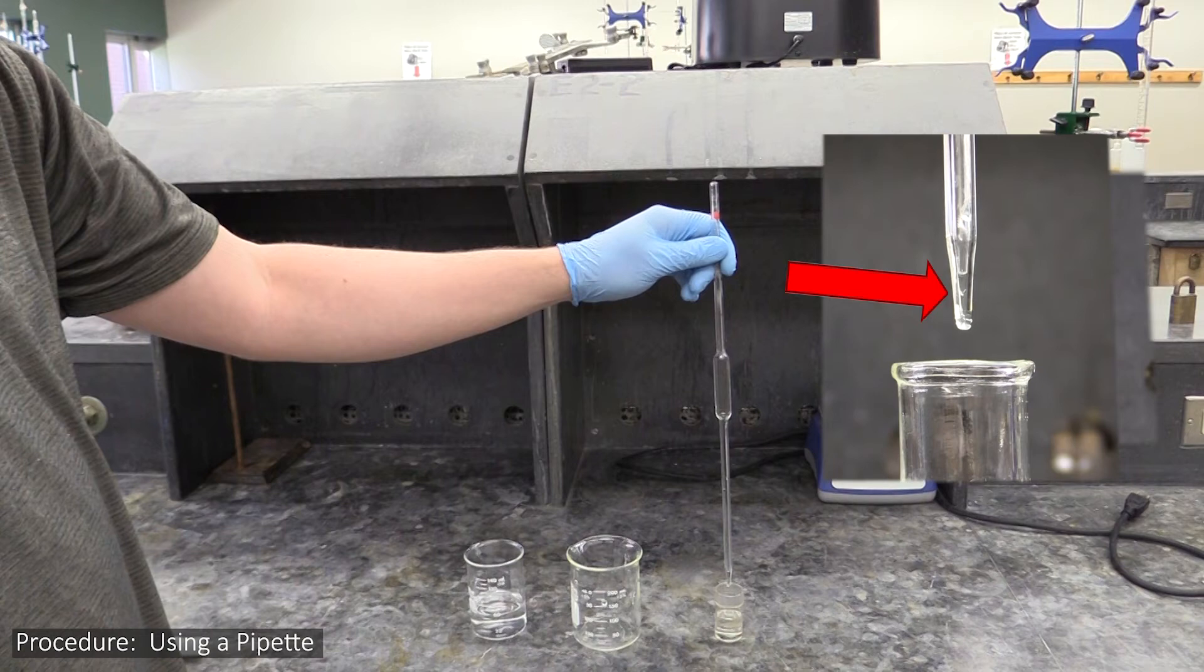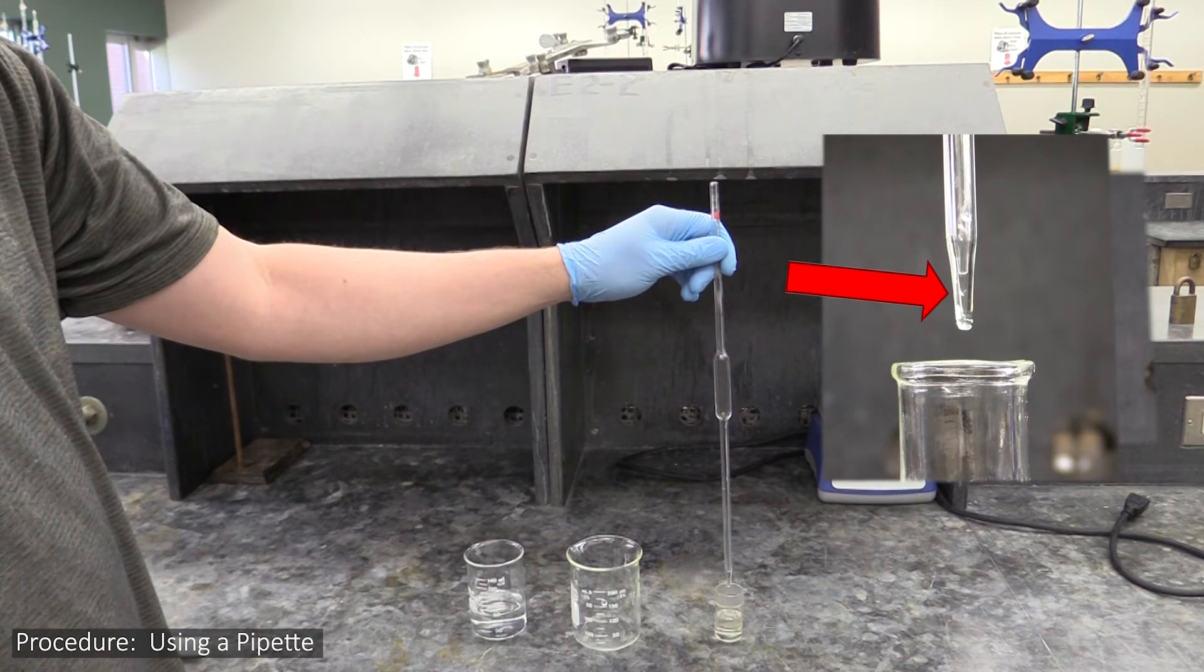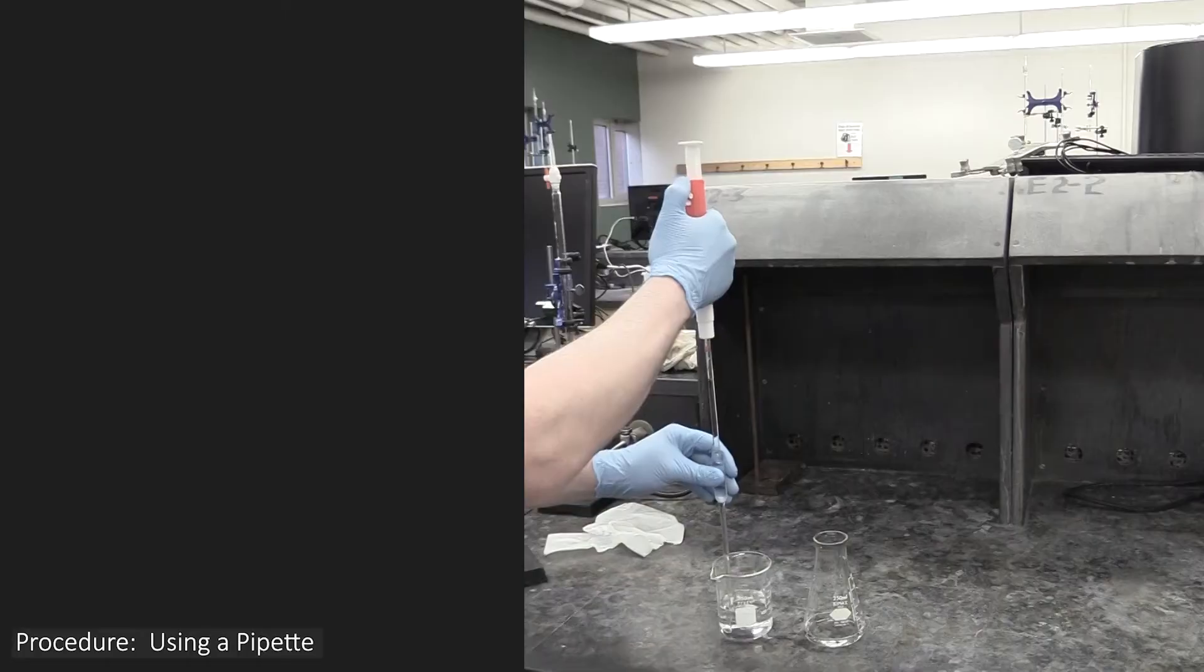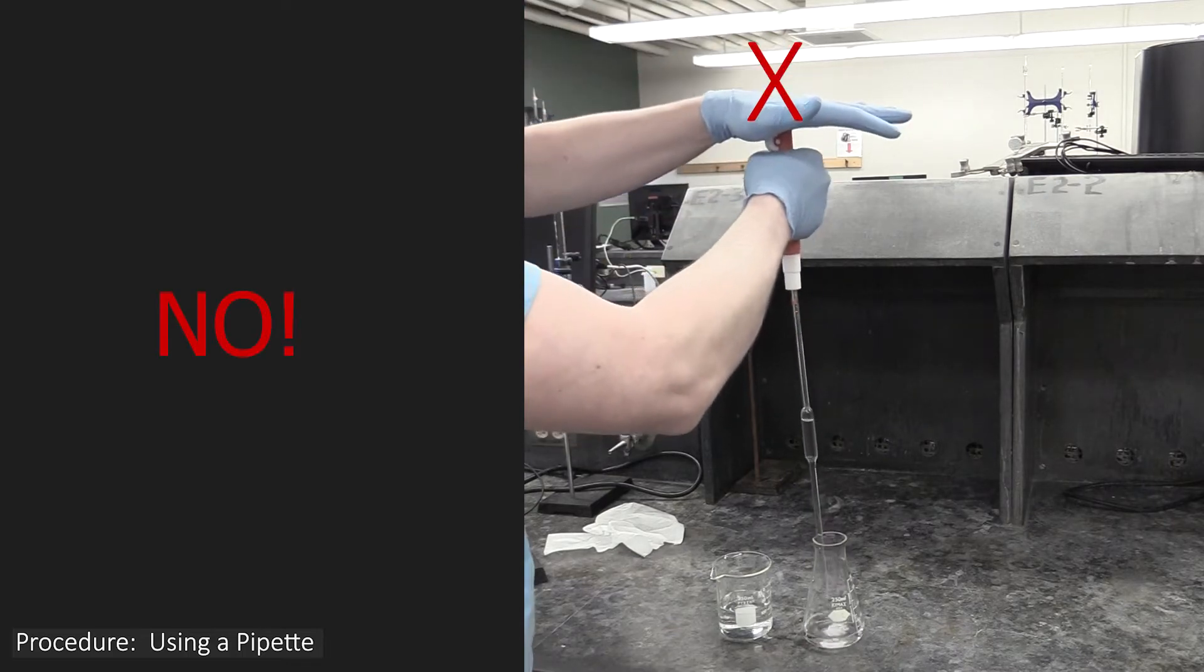If you look close, you'll see a small bit of solution will get left behind in the pipette. It's calibrated to account for this, and this is why you don't want to use the pump to force the liquid out of it.